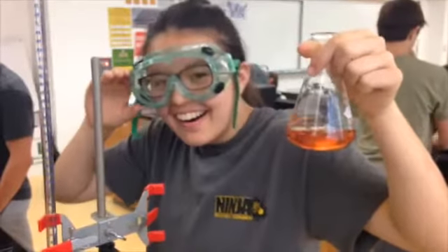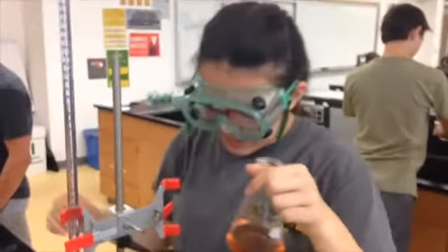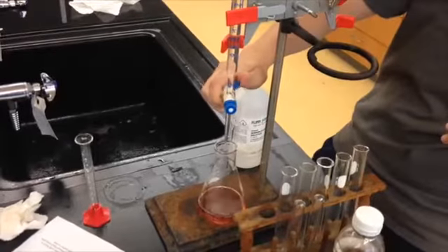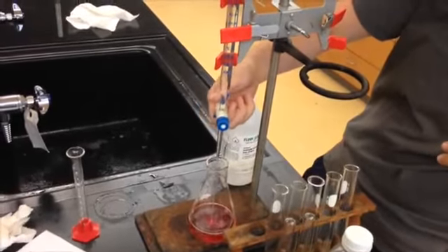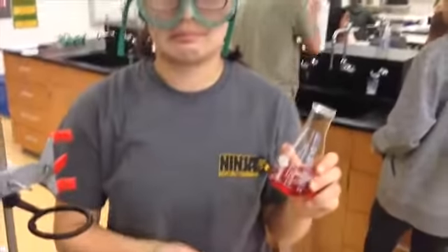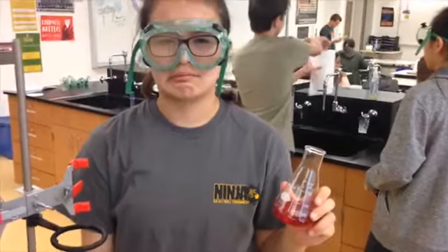This was the equivalence point for our titration. Missing the equivalence point means you added too much of the titrant and sent the system past its equivalence point. This is pretty easy to spot because the solution will turn a solid color.